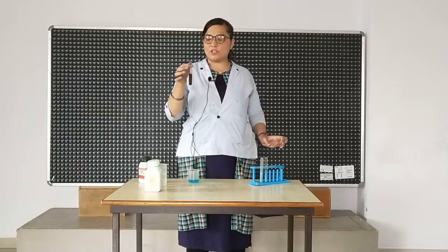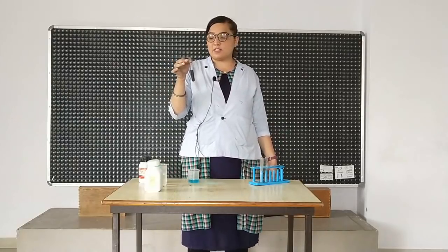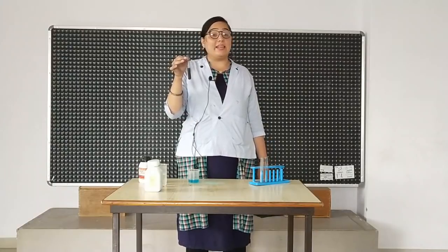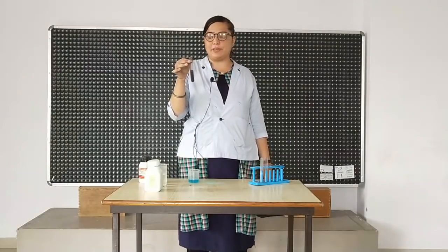and allow it to stand for just a little while. Let's wait till the solution becomes stable.